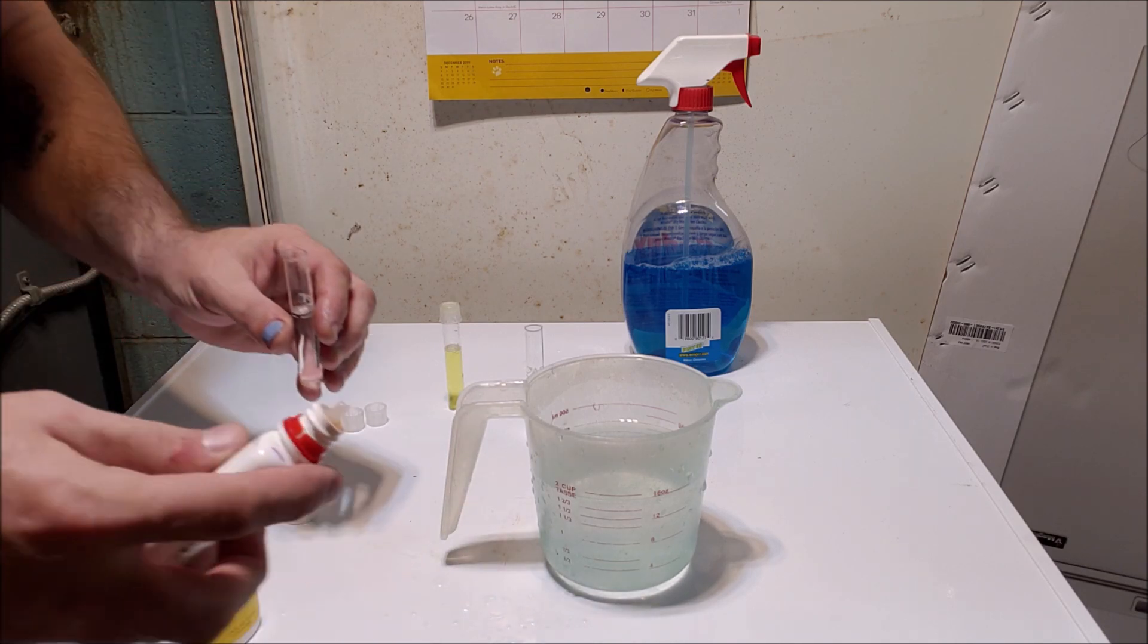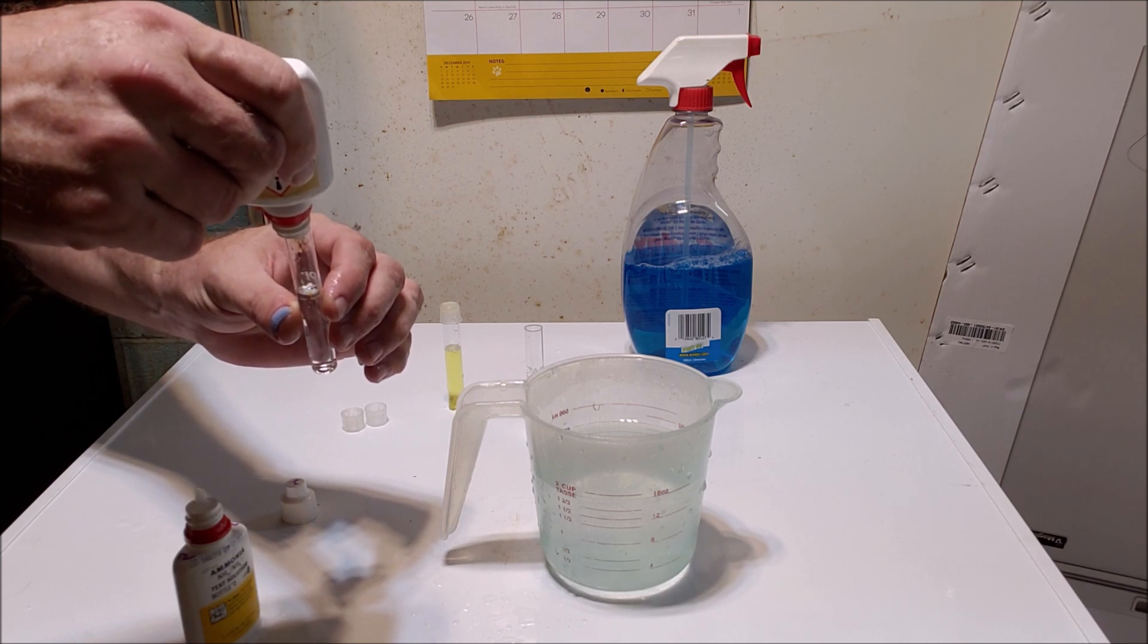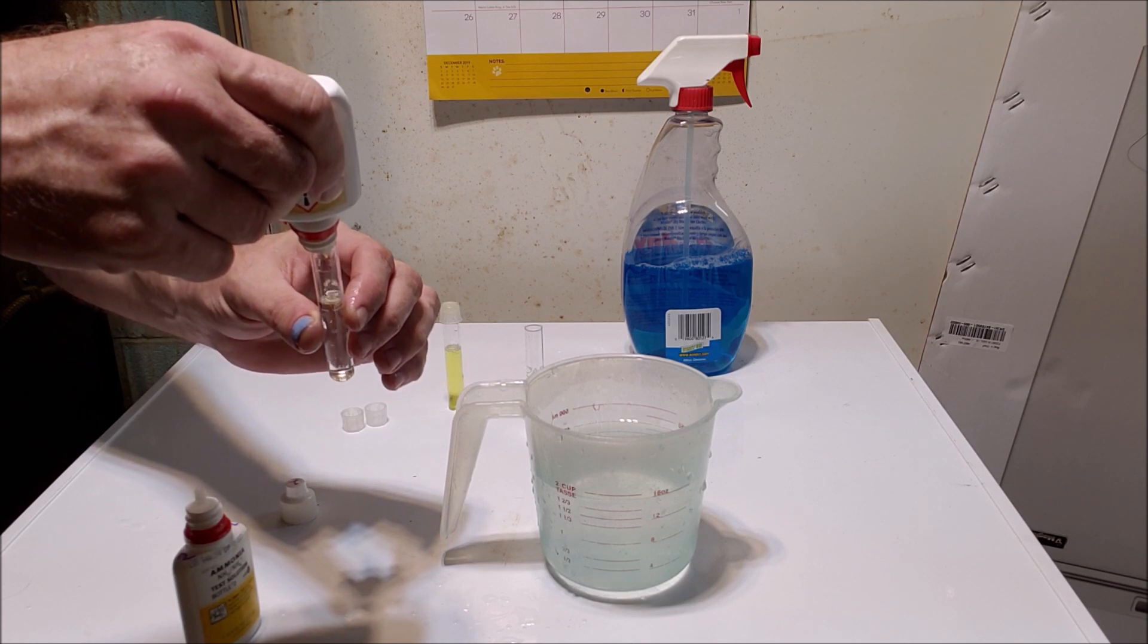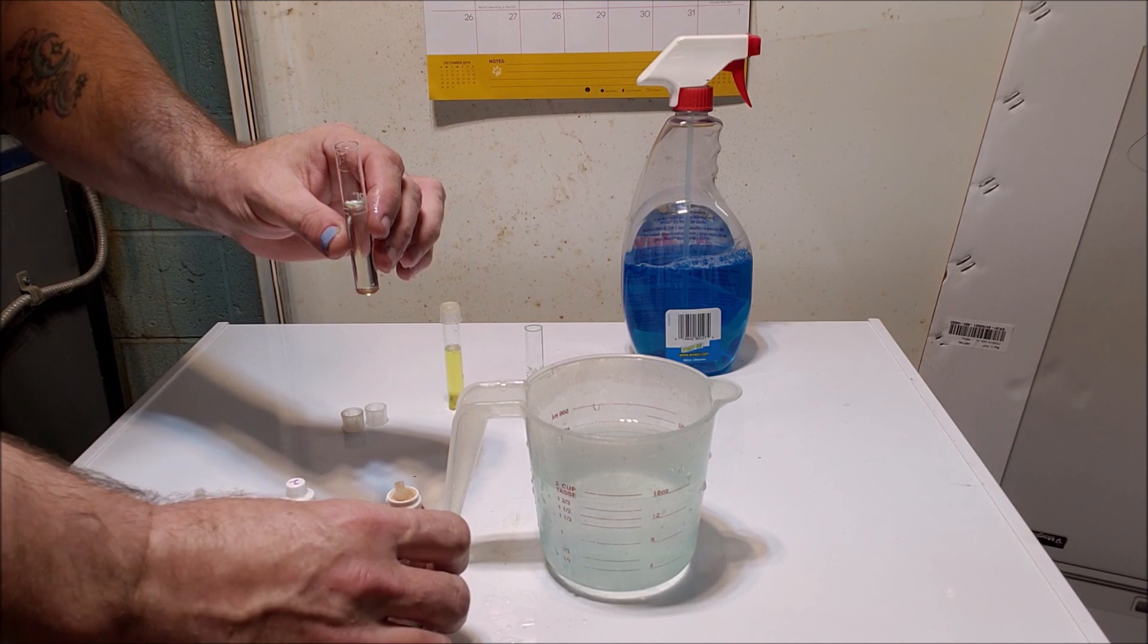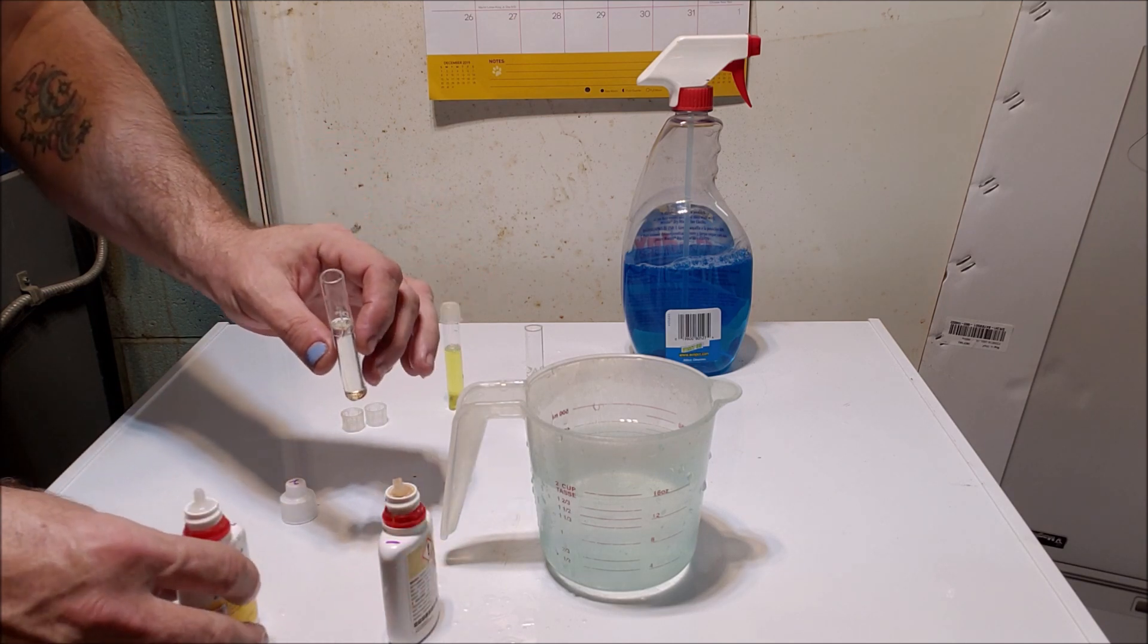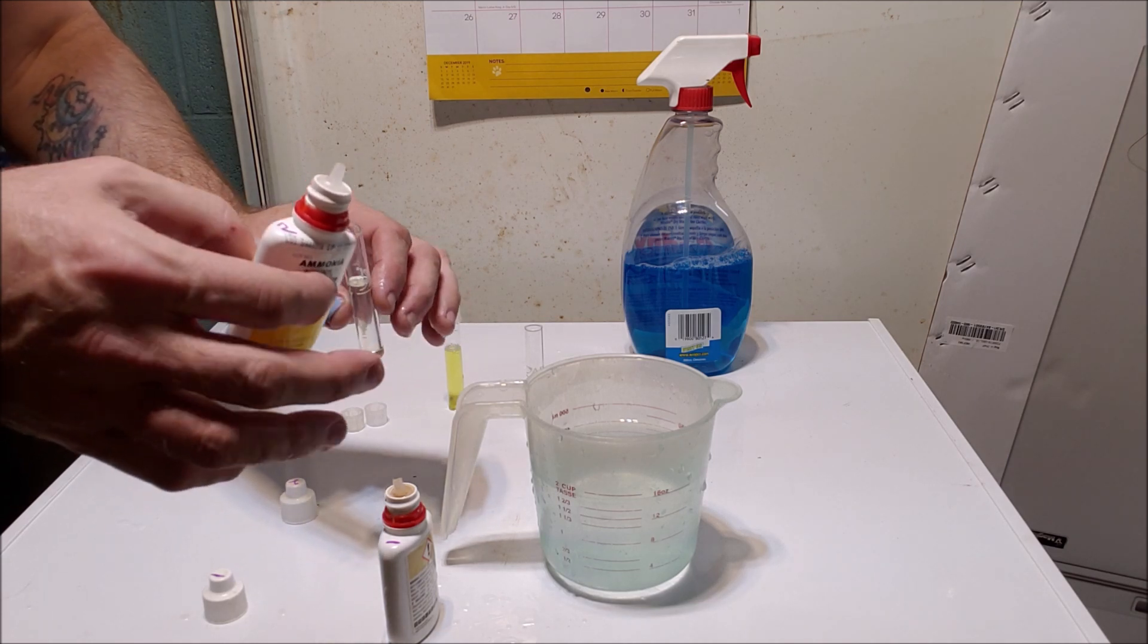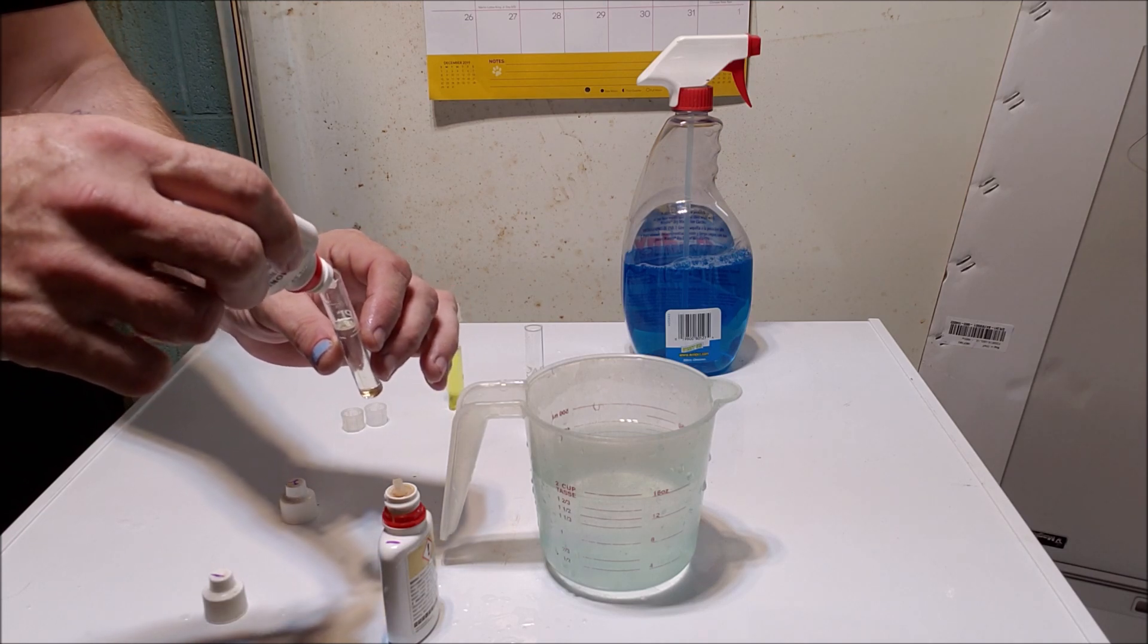So let's try putting eight drops of the first reagent in. The first reagent's thick and you've got to squeeze the bottle pretty hard. So be careful when you pick up the second reagent. This is very runny and comes out quickly. So don't squeeze very much at all when you get to the second one or you'll squirt it out.